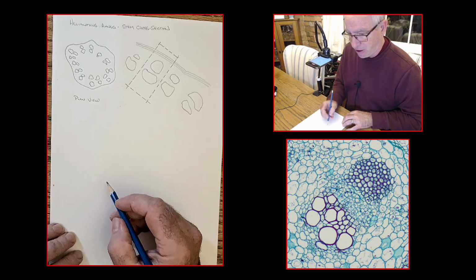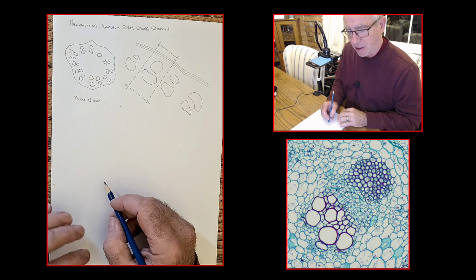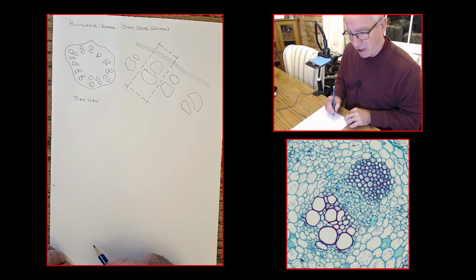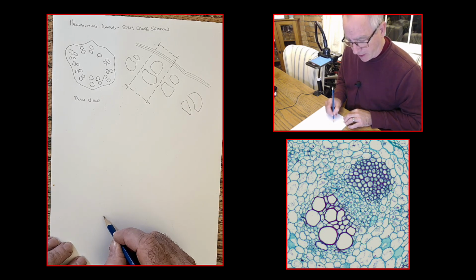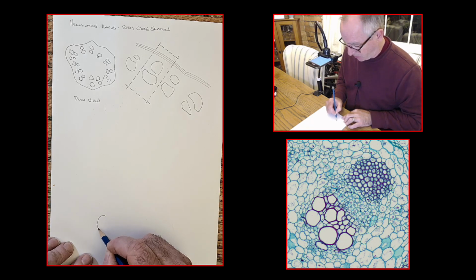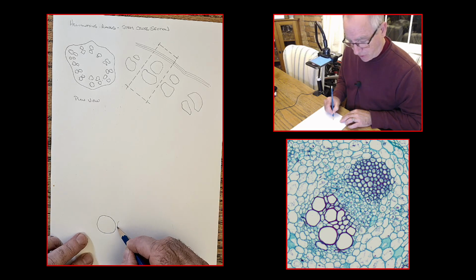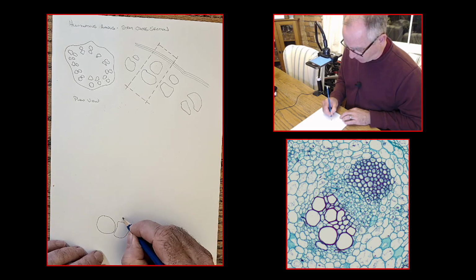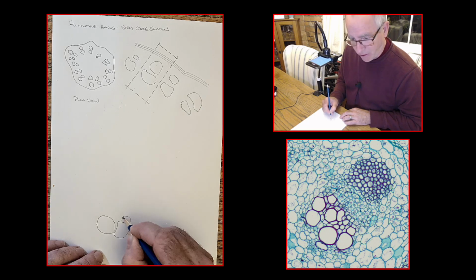The easiest way to do this is to pick the very biggest cells, and that's those xylem, the metaxylem conducting cells that we're looking at there. So we'll want to leave some room down in the bottom left corner here for the big cells that are down around them. But what I would suggest is start with the very biggest conducting cell, and it's almost circular. You can do this, put that in there like that, and then try and draw some of the adjoining ones like this. And you can see, again, my artistic skills aren't amazing, but I'm taking my time drawing each cell to start with, and I'm drawing them so that they fit together the way that you see them fitting together there in the actual video.